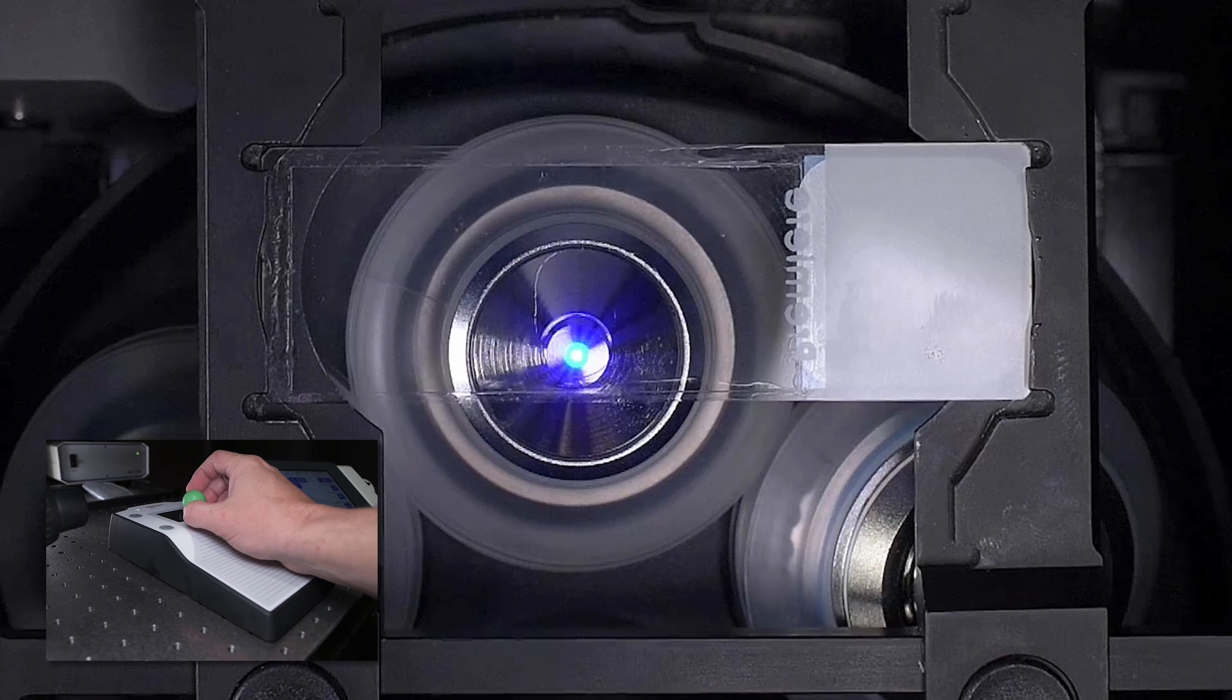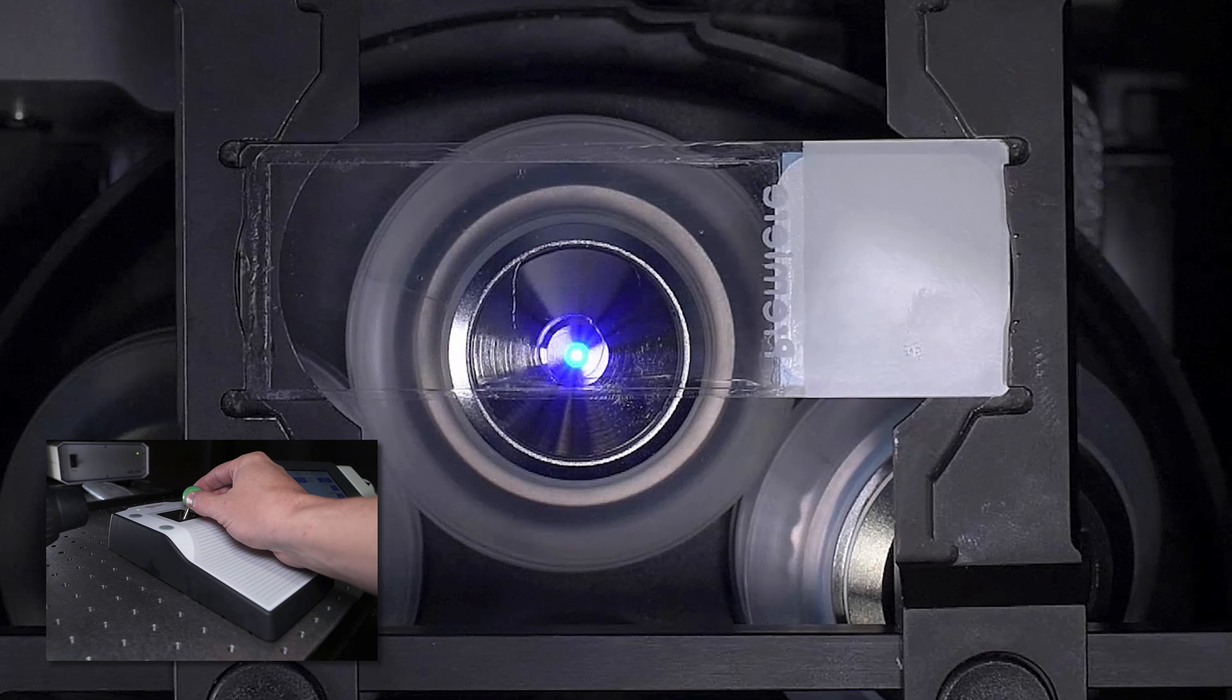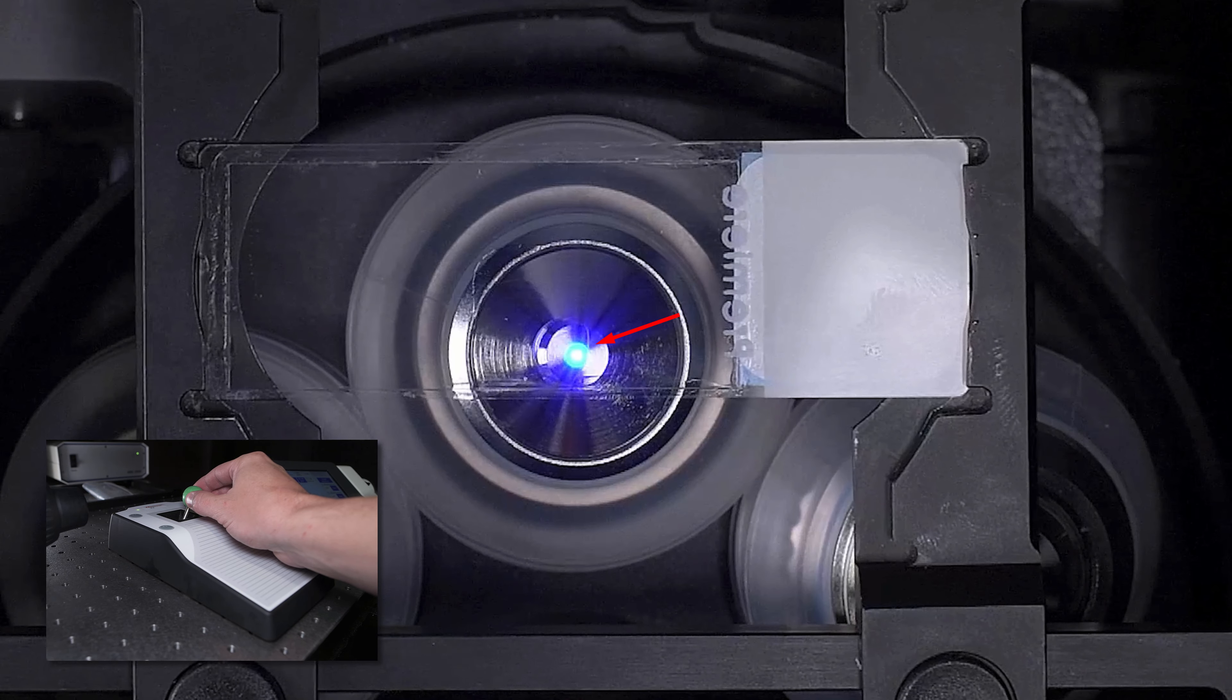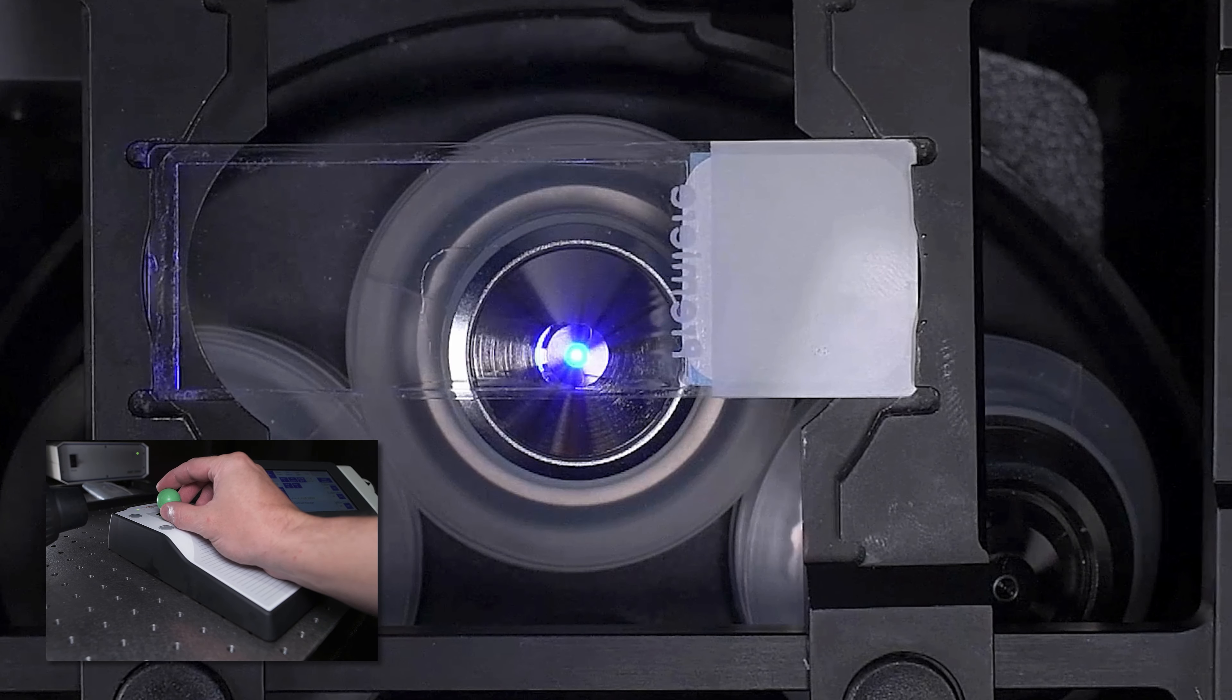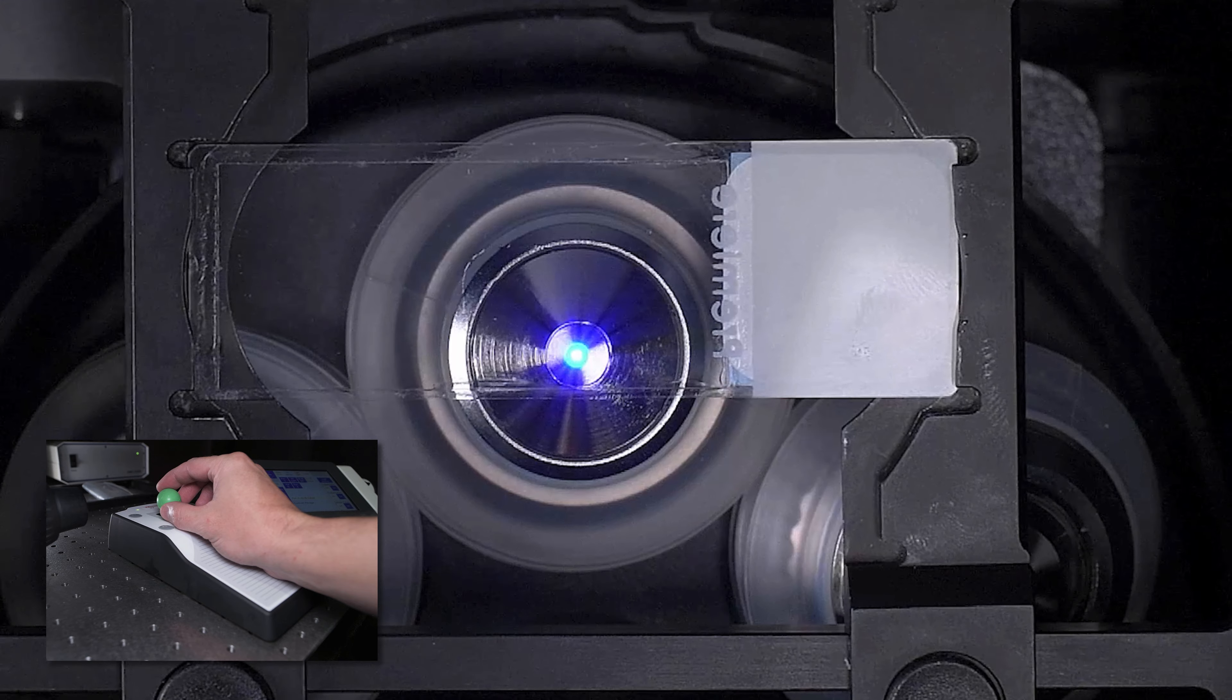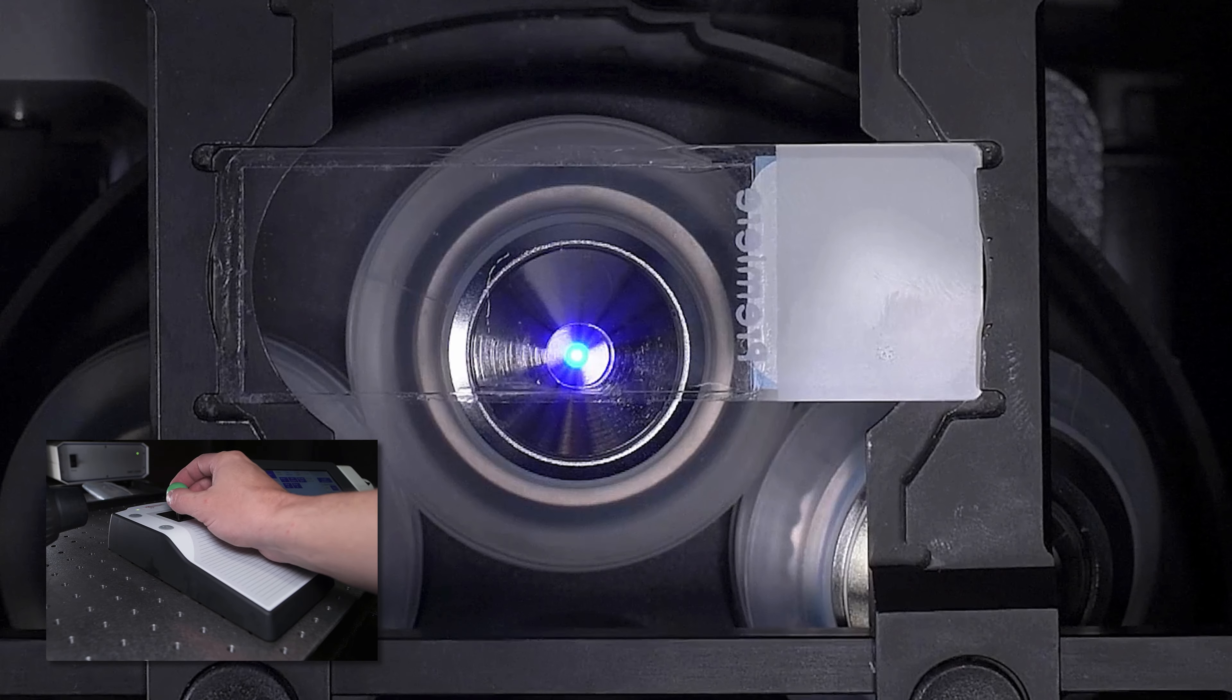The second is that large, fast movements will increase the probability that our oil bead does not cover our front lens. If the oil loses contact with our lens, we will not be able to focus, so please go slow with the stage movements.